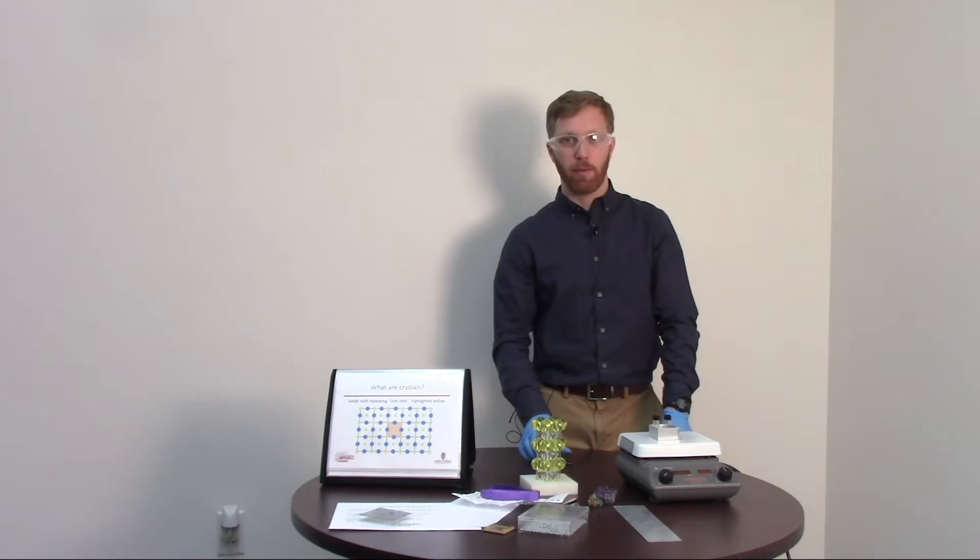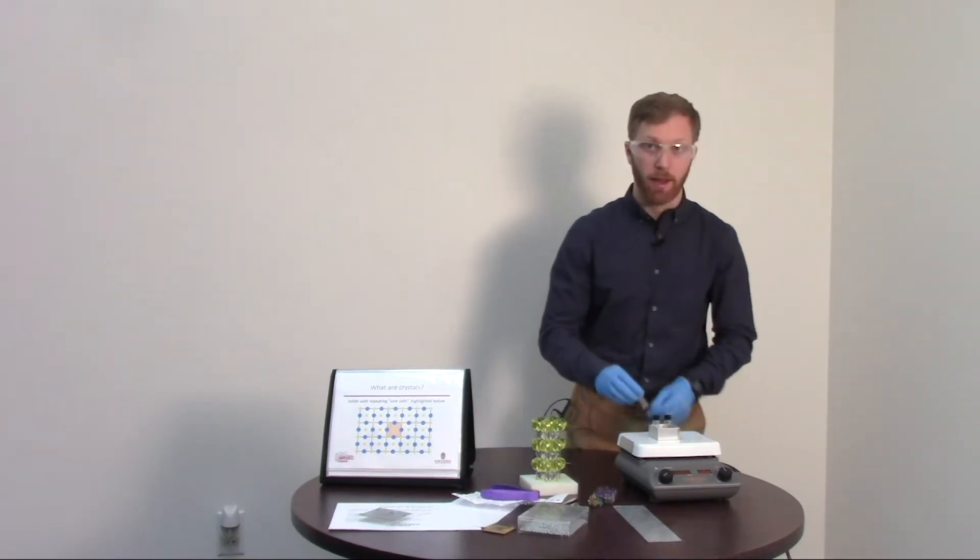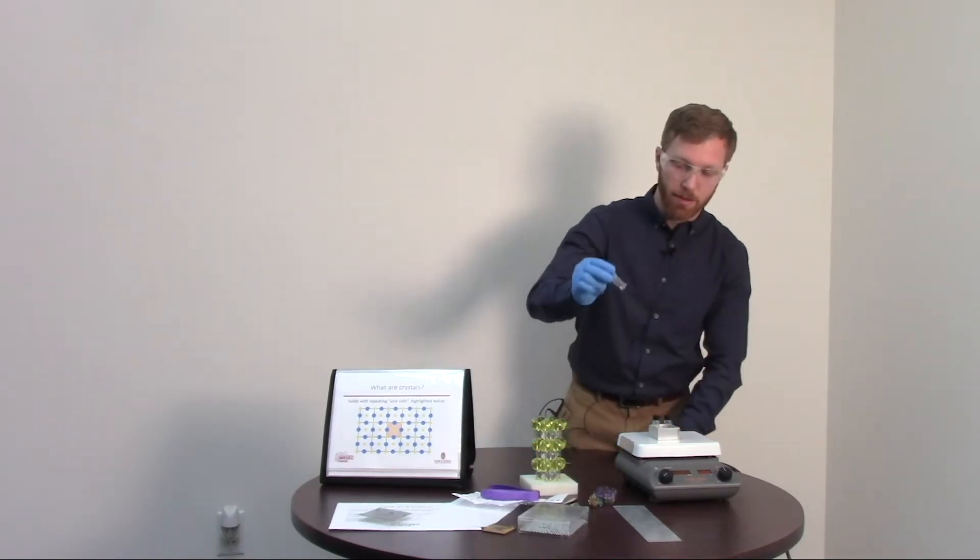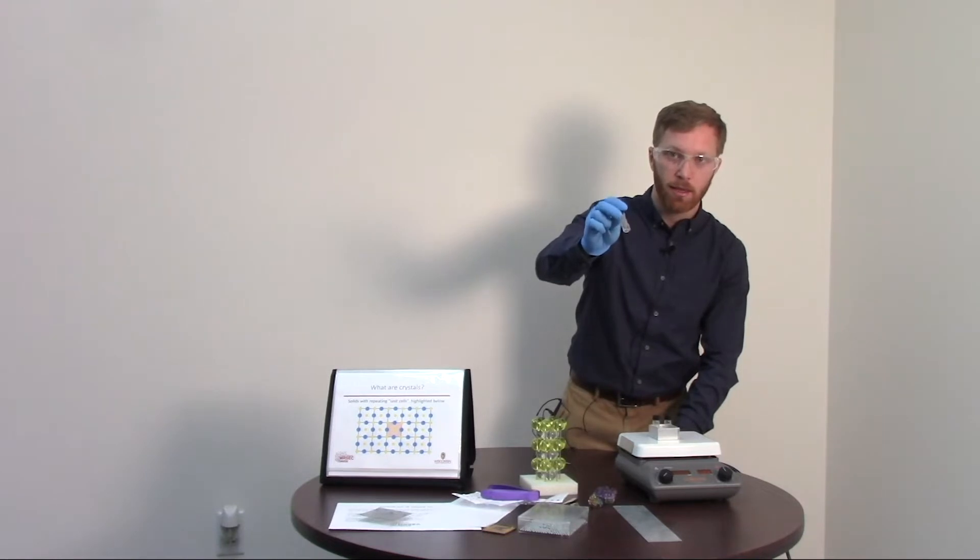Hi there, would you like to do an experiment with me? Alright, well I have here, I've got this little vial with this clear liquid in it.